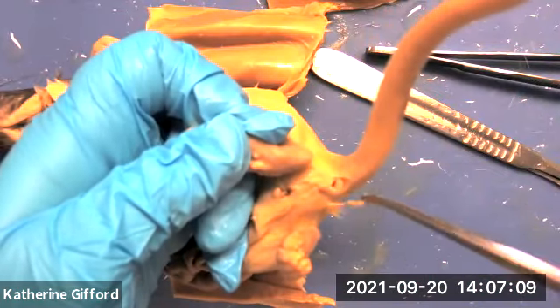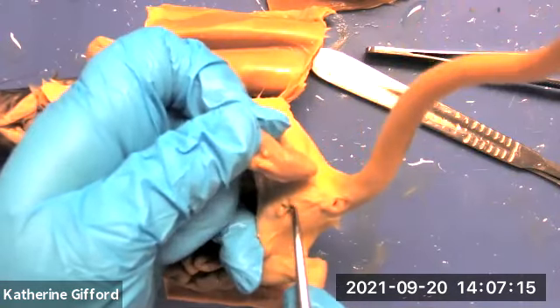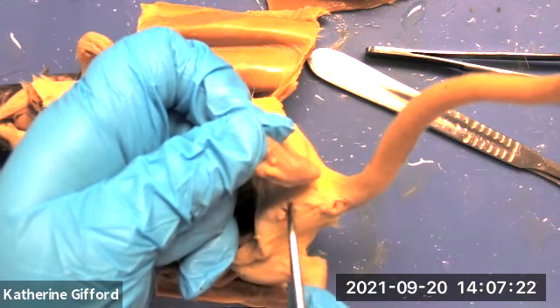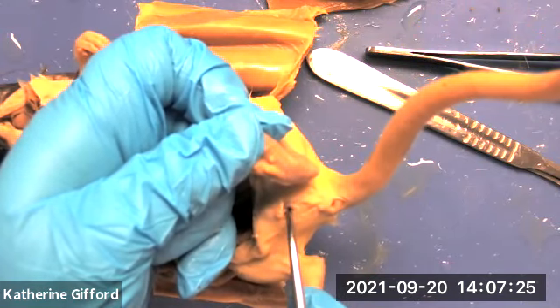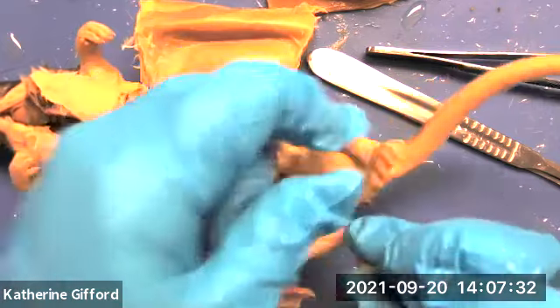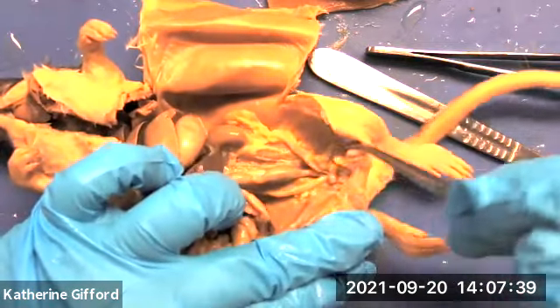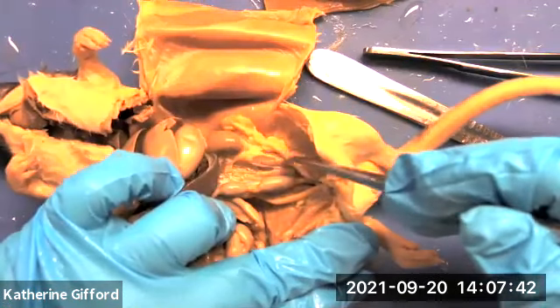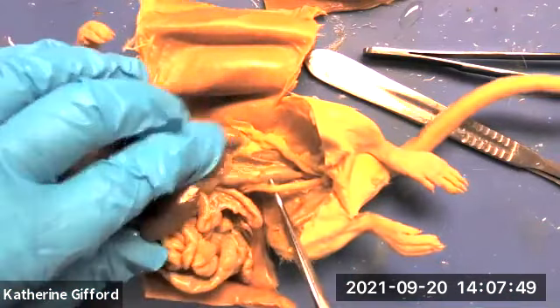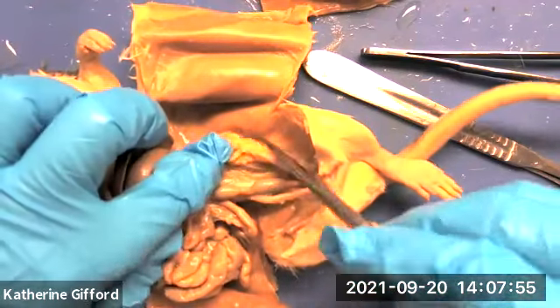Females have only one other external orifice for both the vaginal canal and the urethra, so this is the vaginal opening. The urethra dumps into the vaginal canal, so urine would also come out there as well. This is a female that's never been pregnant. This is what we call a uterine horn — this would be the other one. They're set up to have litters instead of single fetuses.